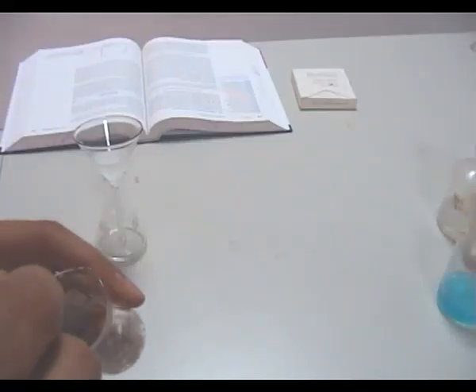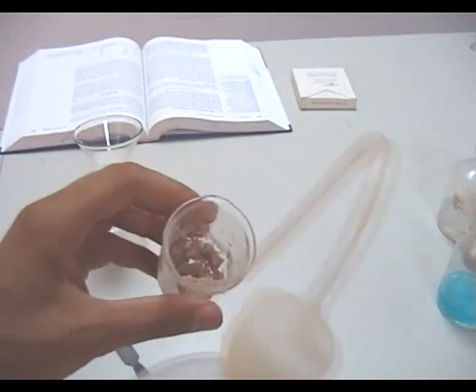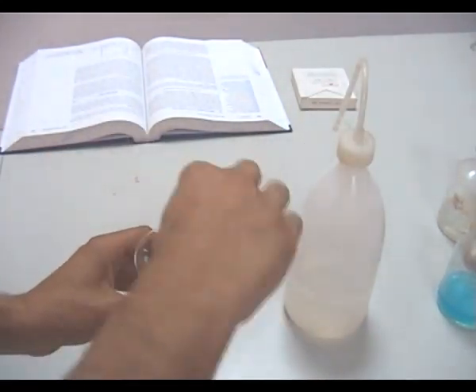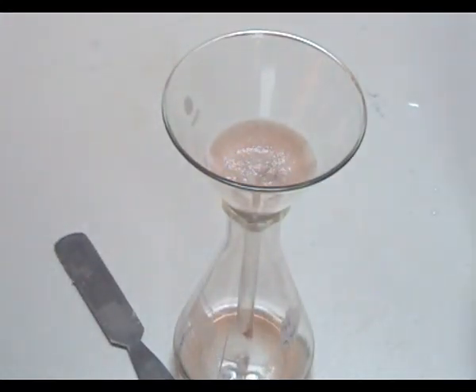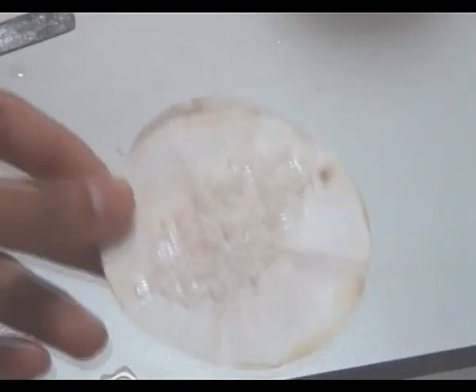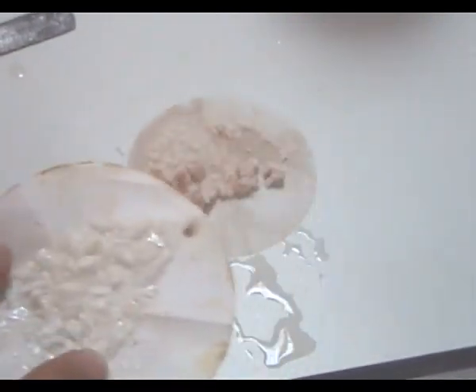Then we will wash it with water. We will crush the crystals, filter them in a funnel with filter paper, and wash them with cold water. This will dissolve the acetic anhydride or the acetic acid which is produced, as mentioned in the theoretical part of this movie. After two or three washings with water, we will obtain pure white crystals of paracetamol.